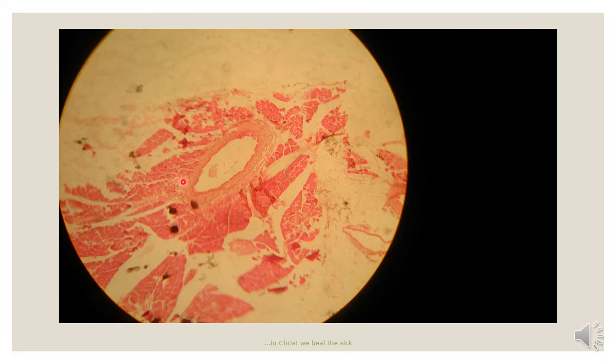One thing that characterizes most of the muscular arteries is that the lumen is rarely collapsible because of the thick muscular tunica media. So in this slide, even though it seems compressed, it is still not collapsed, unlike what we can see in this particular one, which is actually representing the muscular vein, which looks collapsed.